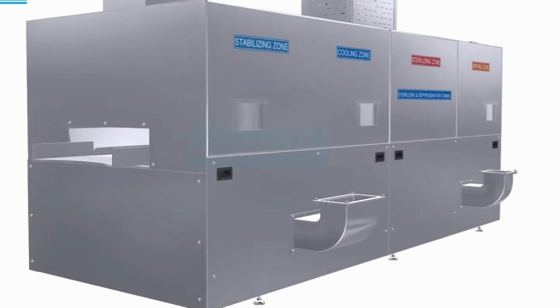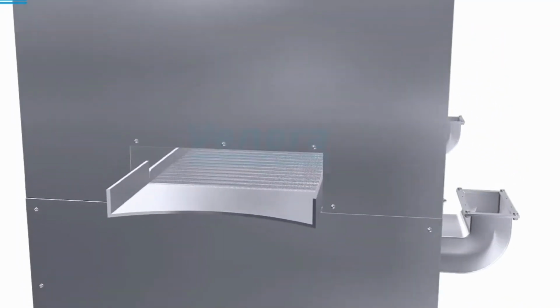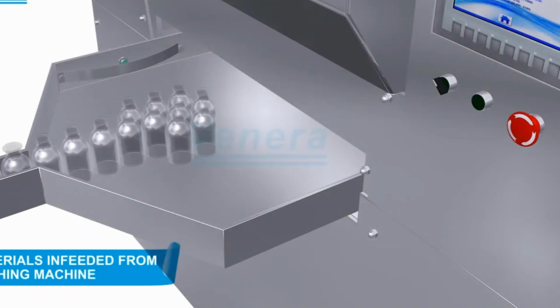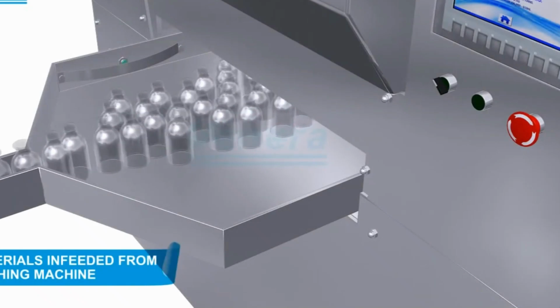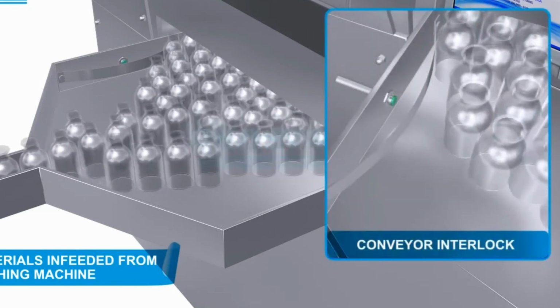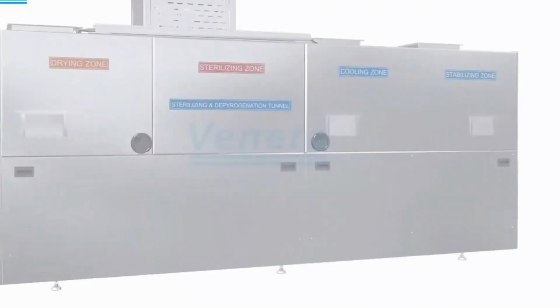Holding zone. In the holding zone, the containers are maintained at the high depyrogenation temperature for a specific period, ensuring sufficient heat exposure to destroy endotoxins. The holding time is critical to ensure complete depyrogenation. This is based on the heat penetration validation study, confirming that even the coldest spot on the vial or ampule reaches the target temperature for an adequate duration.